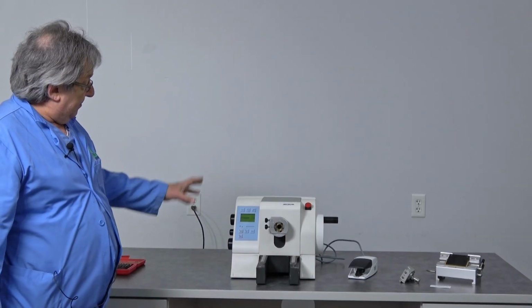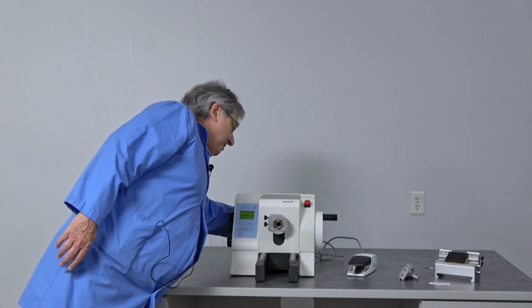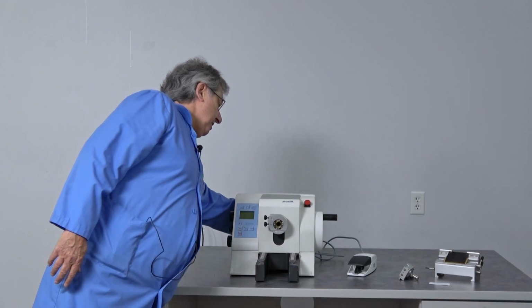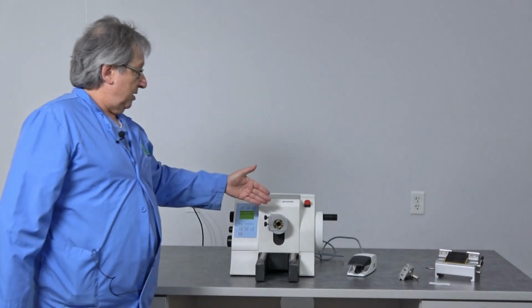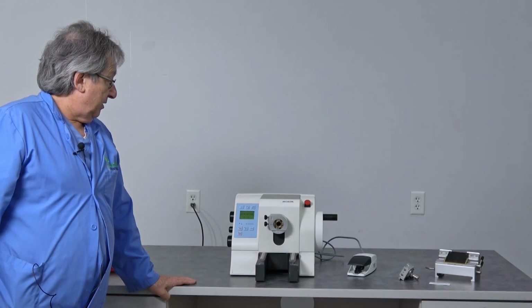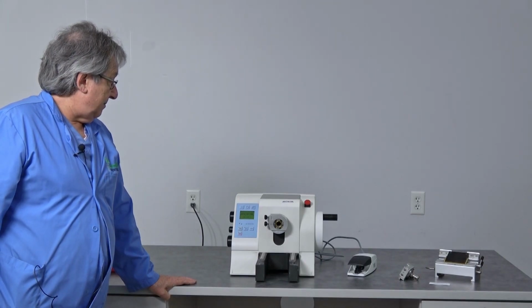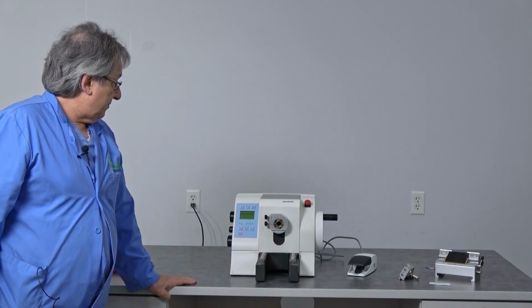So anyway, that's going to be the unit, and we'll show you one last time that it will go ahead and initialize. That head is out to an extended position, but it will complete the initialization. There you go.